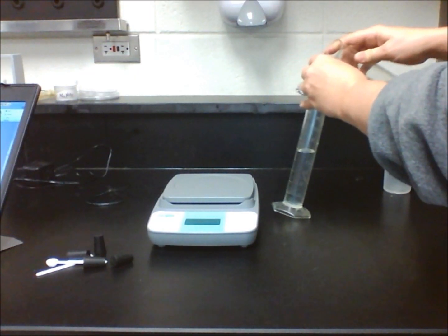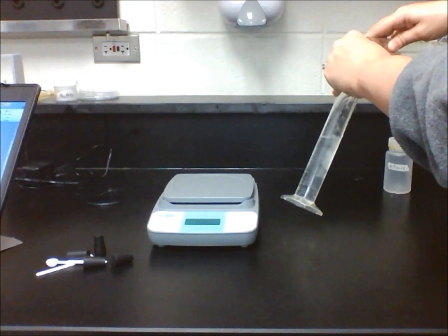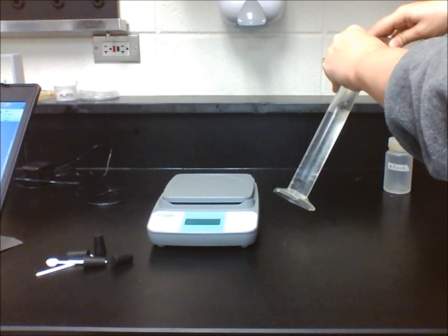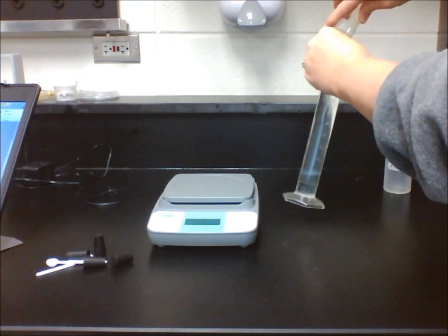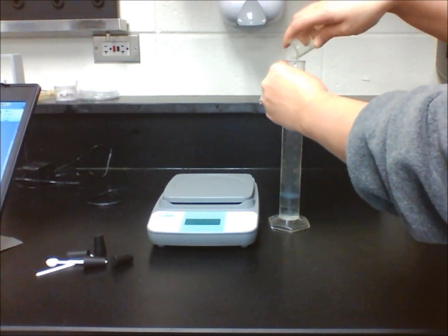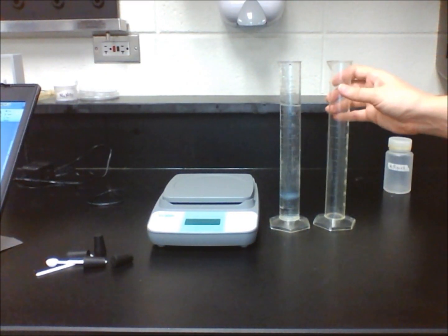Carefully pour the ethyl alcohol into the graduated cylinder with the water. Allow a minute for the ethyl alcohol to drain completely from the graduated cylinder, and be careful to avoid spilling any substance.